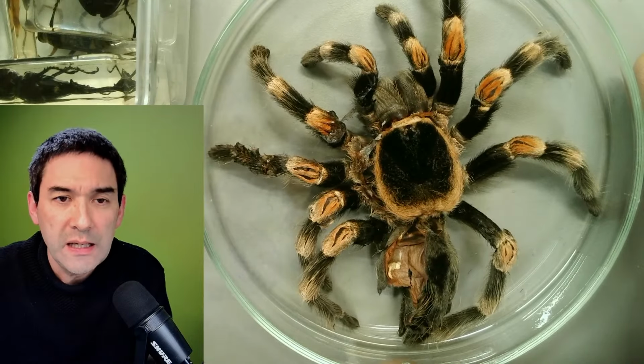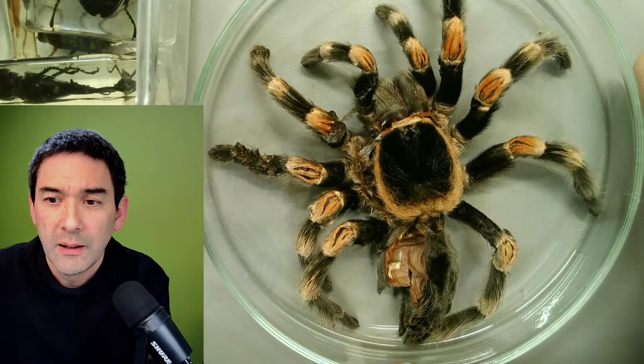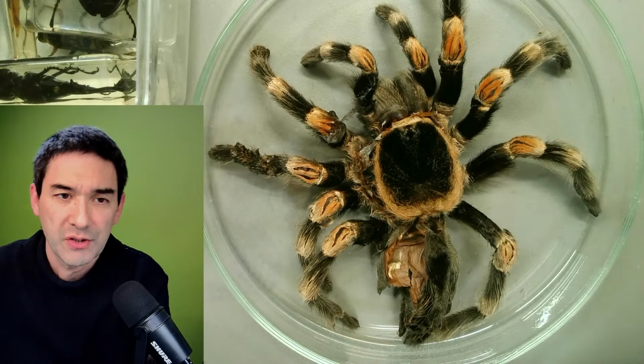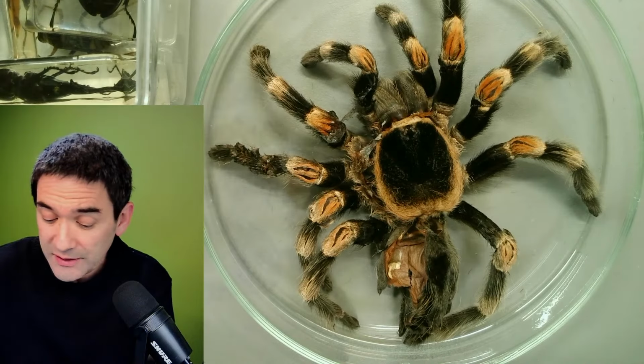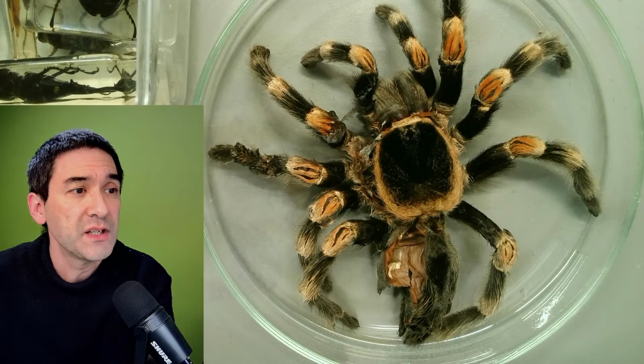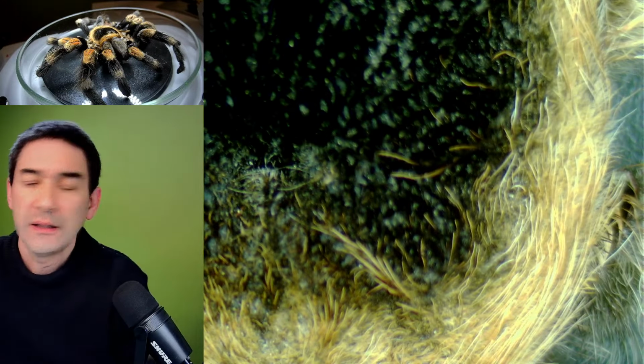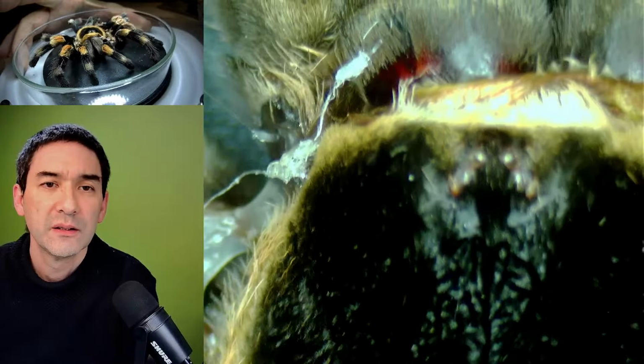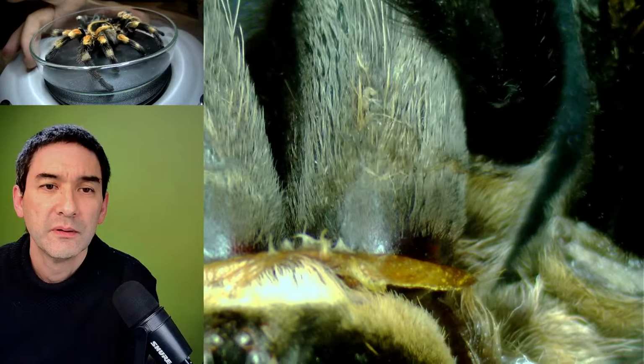I think it's a fascinating creature, not one that I like looking at, I have to admit. But I want to have a look at it in any case under the microscope because I've never done this before. So that's actually one of the nice examples of stereomicroscopy that we can do like this. I'm going to zoom. We have to zoom out all the way, and it's a hairy creature. So this is how it looks. Look at all of this.